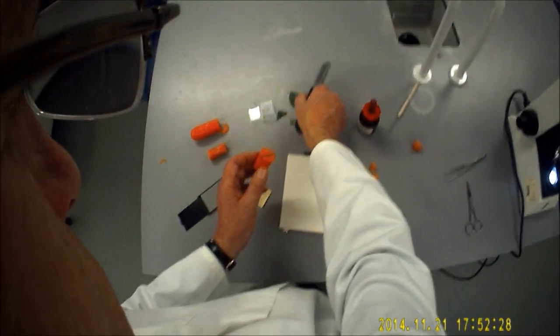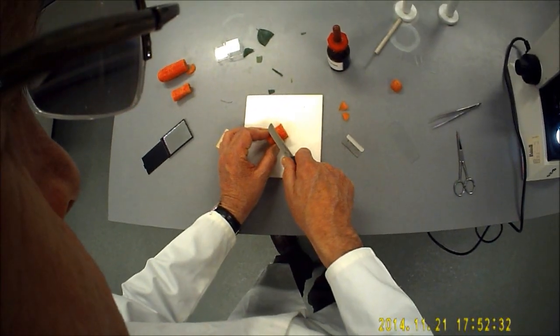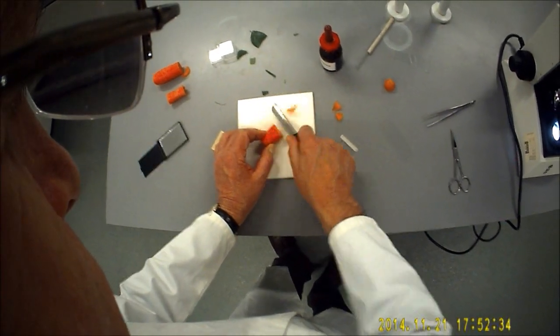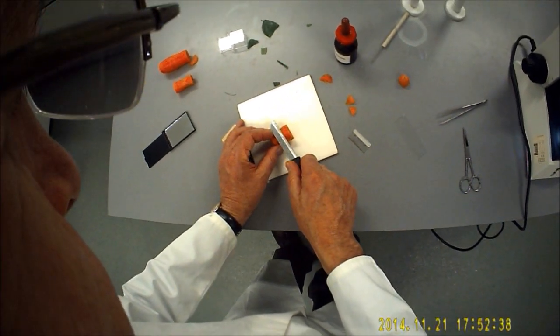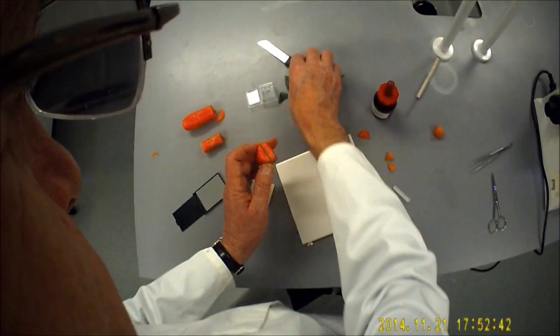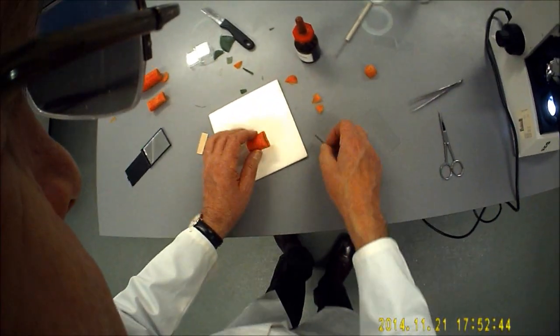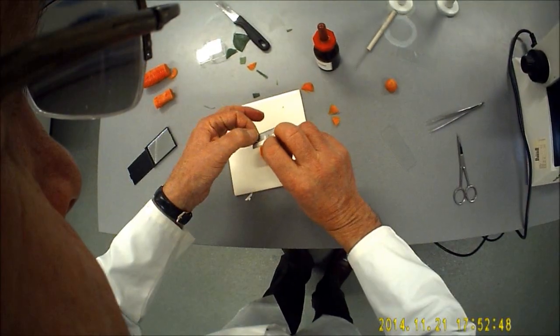I don't want to spend all my time cutting carrot because what I'm going to aim to do is I'm going to try and take very thin slices of the carrot, and in doing that I'll also capture some very thin slices, I hope, of the leaf as well. So we'll start off there.